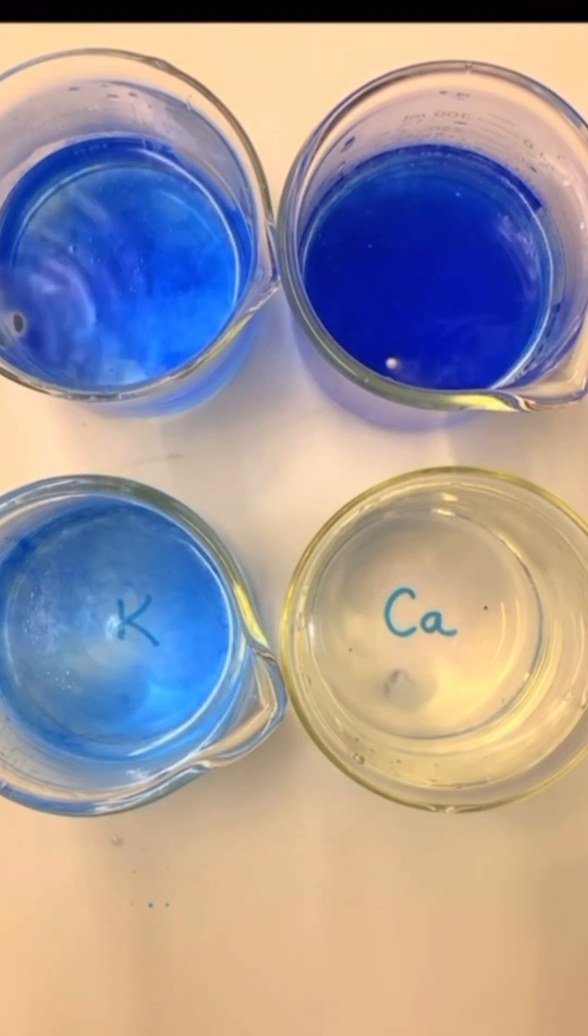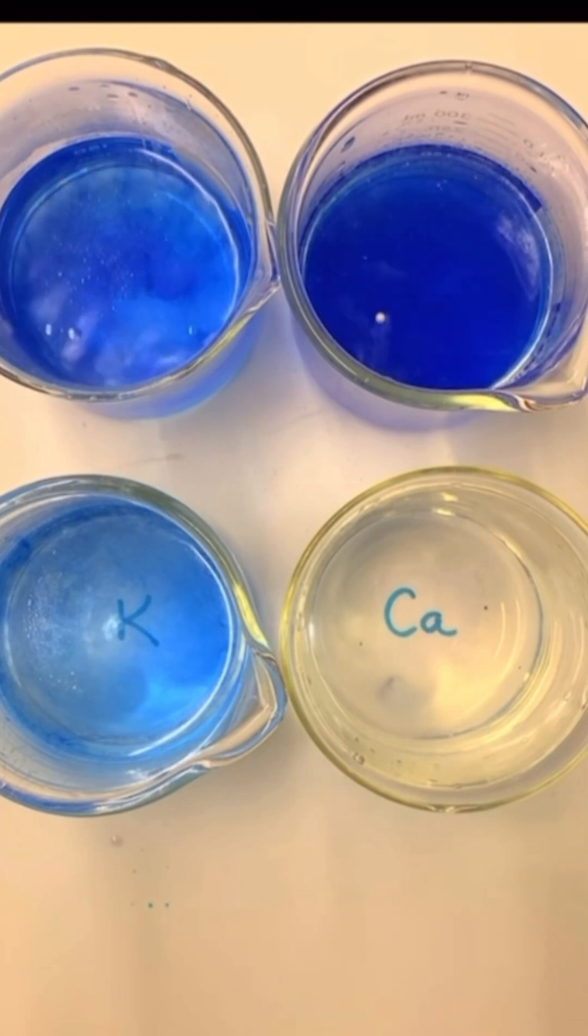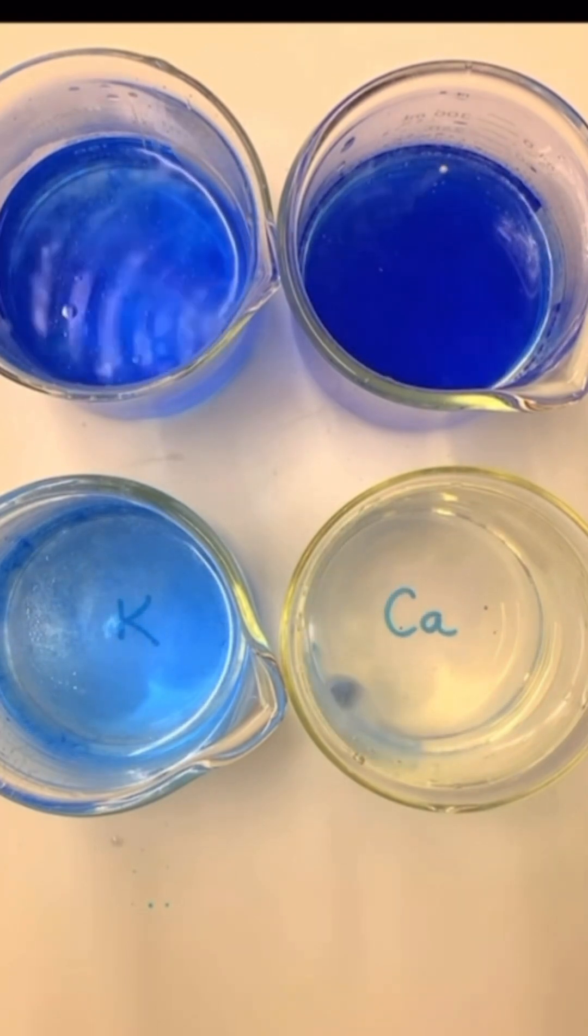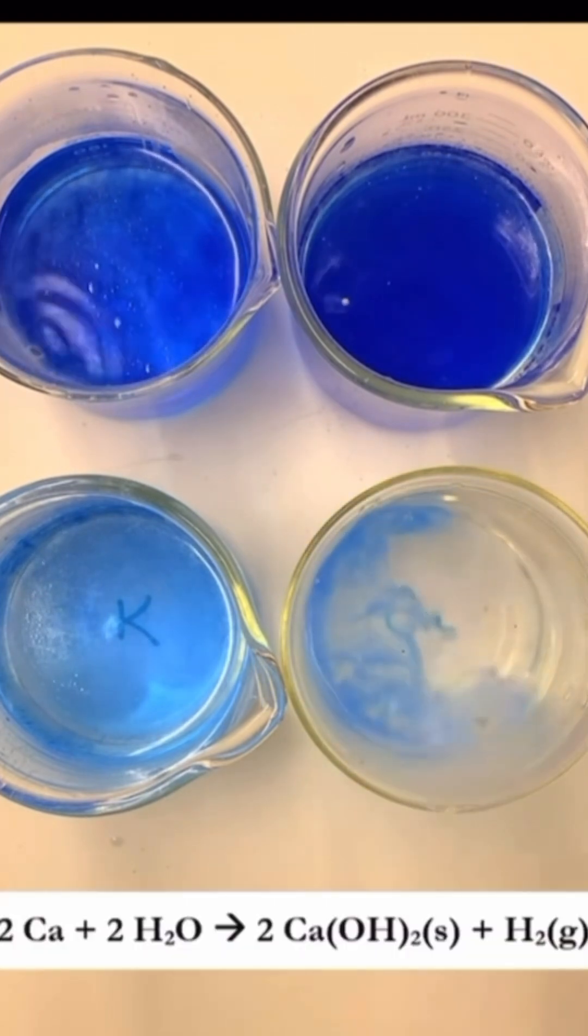Finally, calcium. It reacts moderately, forming bubbles of hydrogen gas and, you guessed it, turning the water blue due to calcium hydroxide.